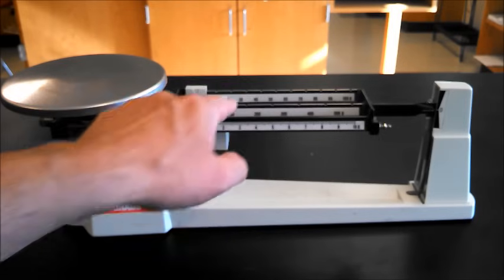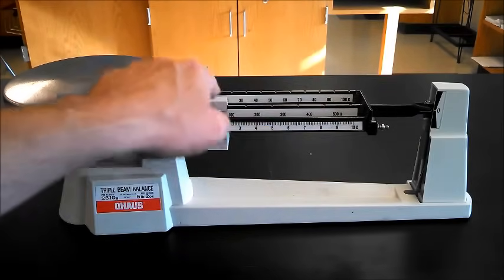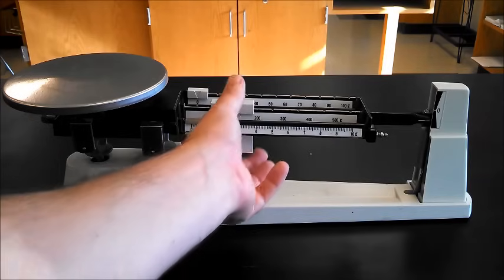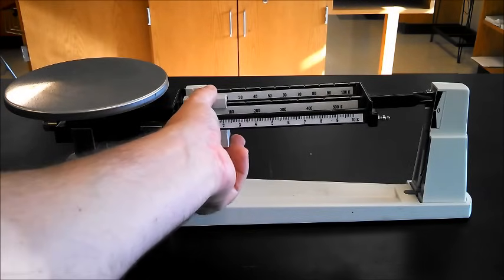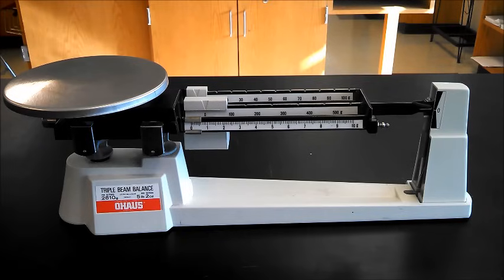Now, we also want to note that there are little grooves on these two arms where the weight fits into. We want to make sure when we move these weights back and forth, it falls into those little notches. Otherwise, we're not going to get the right results.